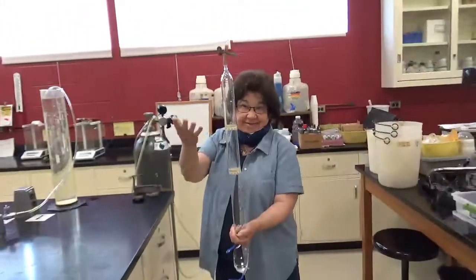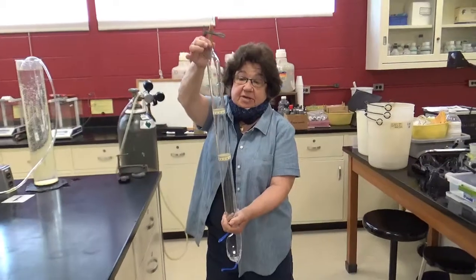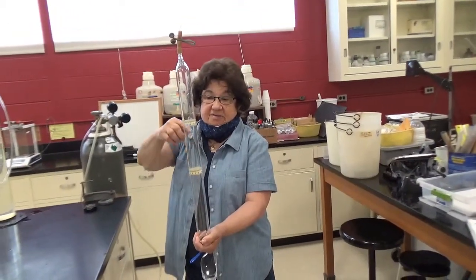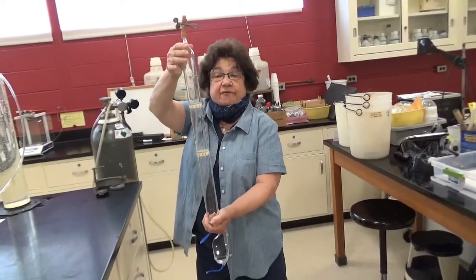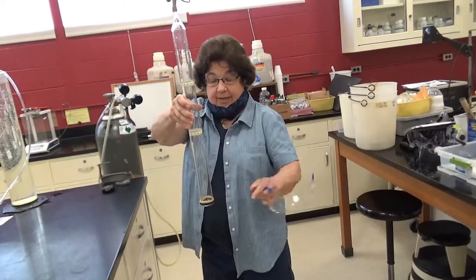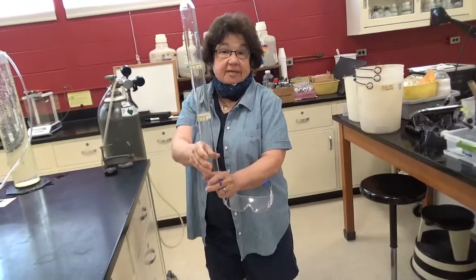We're going to have to use water to figure out how fast it leaves. So we're going to fill this entire tube with water up to here. We're going to bubble in some of the gas. We're going to close this off. The gas will fill the tube, and the water will come out the bottom, and the tube will be filled with the particular gas we're going to be using.